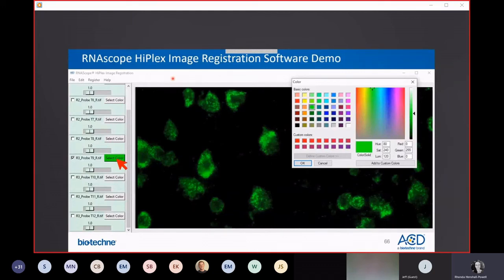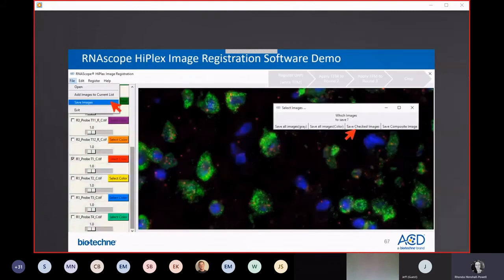The software, while really great at overlaying these images onto one another, and you have all of these color choices, it's really not designed for downstream analysis. You want to use this software to overlay the images, but then the better option is to use Fiji or a different downstream software to generate publication quality images. So at this point, you have a couple of different options for how you want to save your images, but I recommend to save them in grayscale for manipulation with different software downstream.